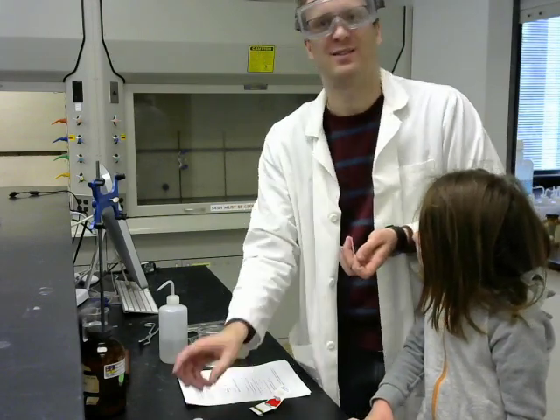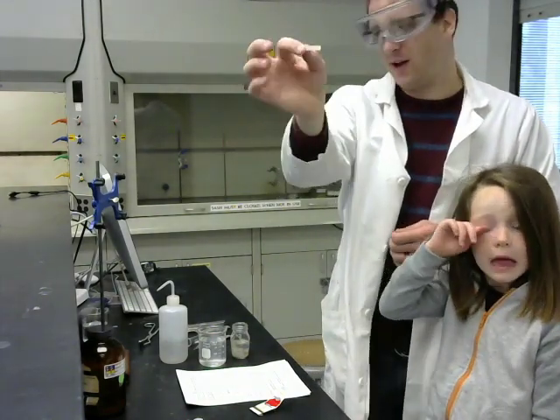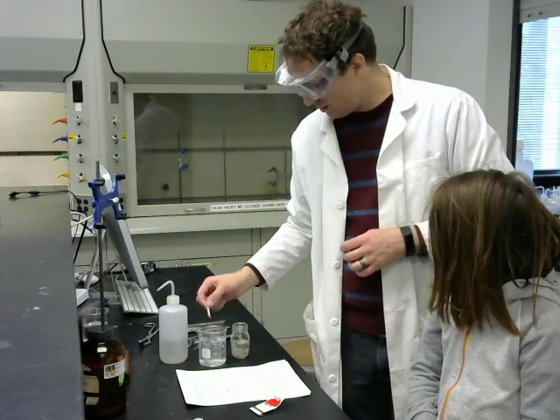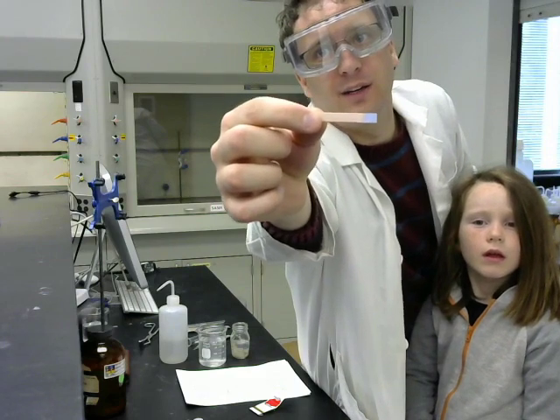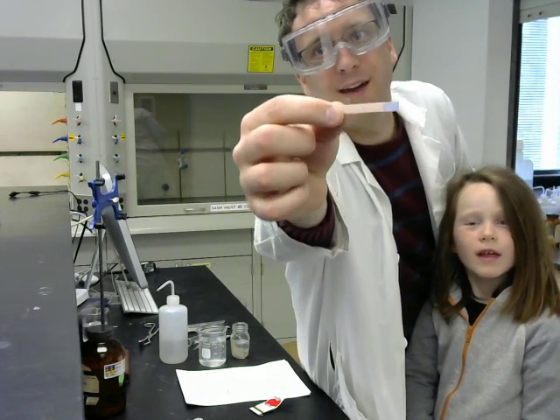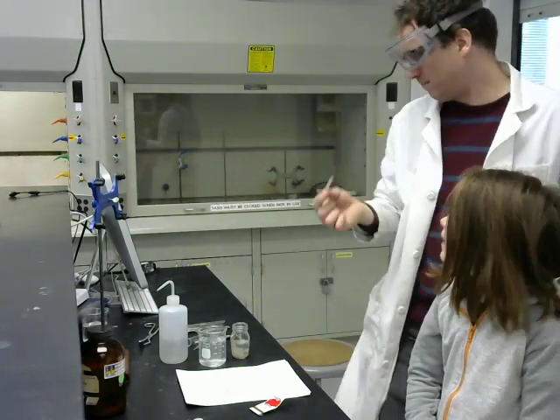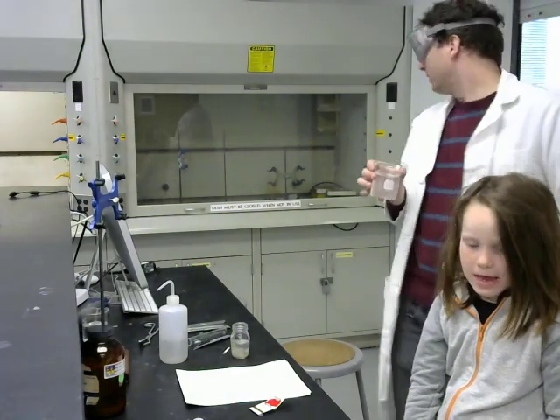Oh, hey, you took your goggles off. It starts basically a pale pink color, but when we dip it in the solution here, hopefully you can see that now it is blue color, and that, good job, team. And that indicates that the solution is basic. It means the opposite of an acid.